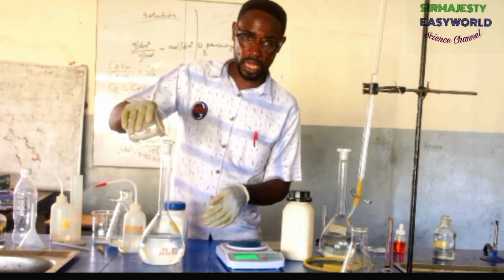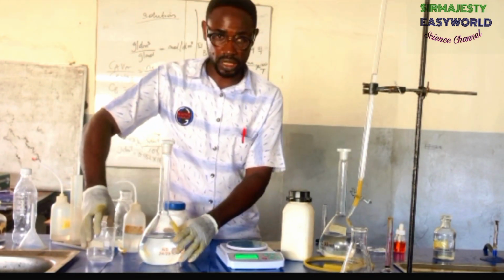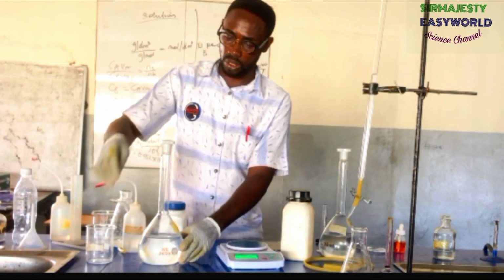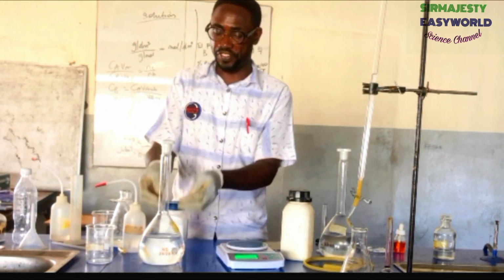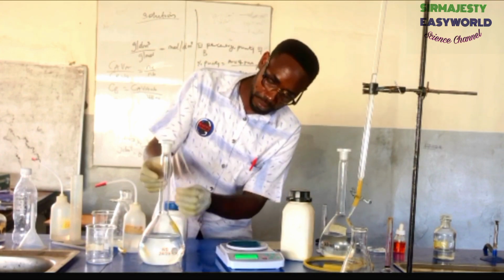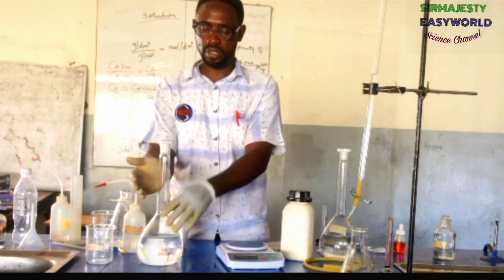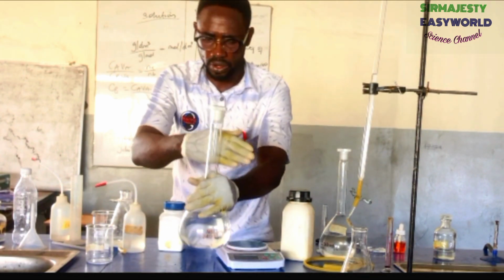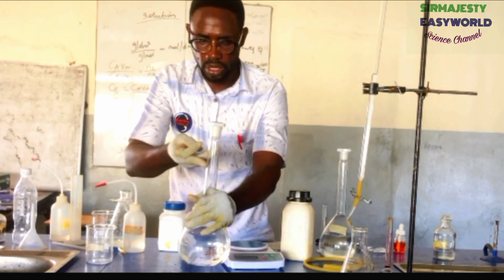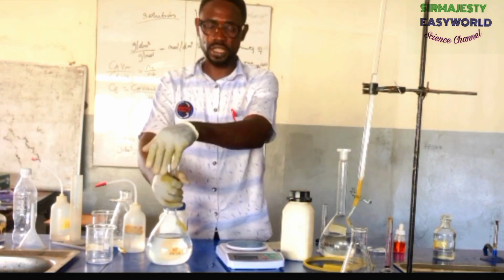So you discard, transfer directly to this. What next? Rinse with that water and put it back here. Then fill this till that ring. Fill it to the 1000 ml mark. There is a ring. Think ahead. This one, you might not see it, might not be visible enough. There is a ring here. So yours will have it. When you fill it, you have made it.